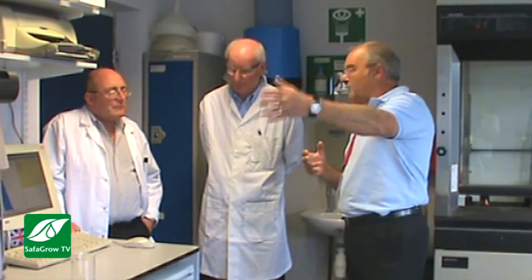Now, one of the things that interests me, apart from that, I see you've got apparatus here, I think that's chromatography over there. This one here is to do with analysing for particle size. Yes, correct. Why should we want to do that? Well, the smaller the particle is, the easier it is to suspend in the water phase, so they'll stay suspended longer.